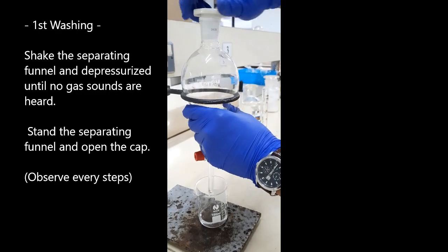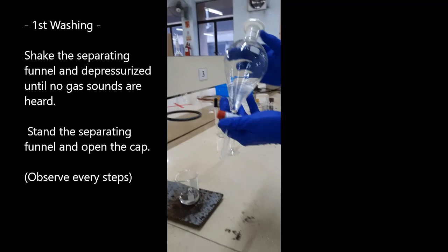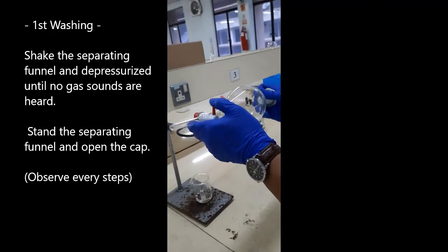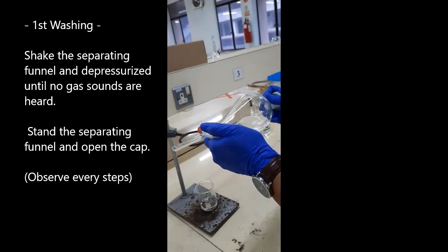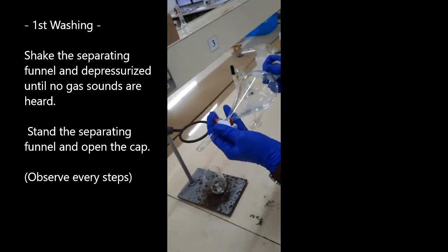Shake the separating funnel and open the valve until gas is no longer produced.